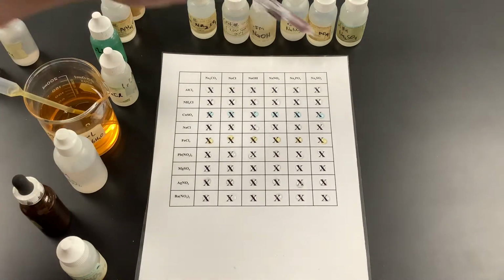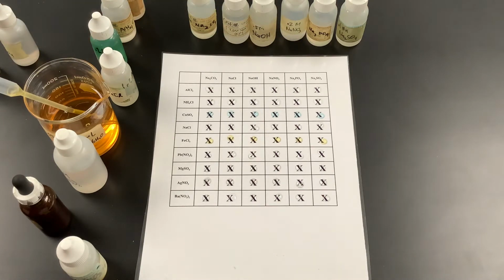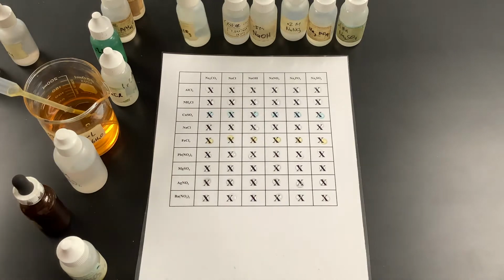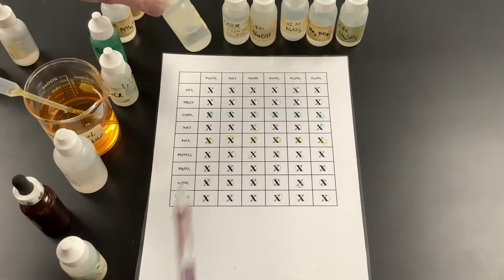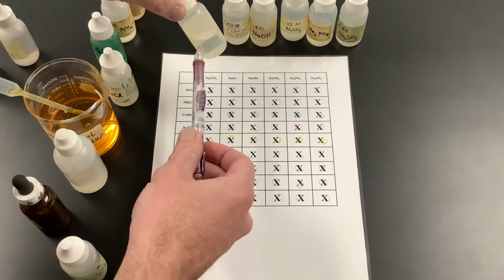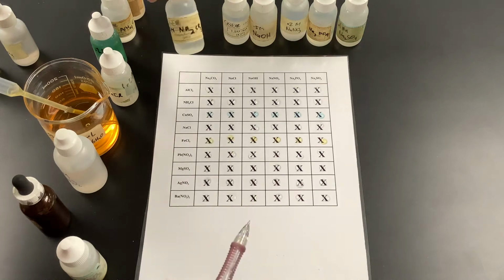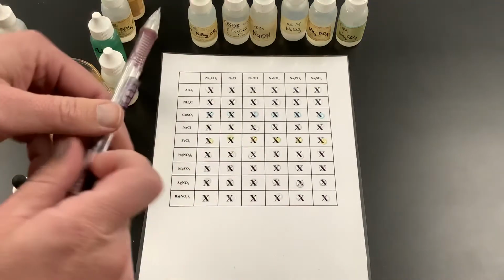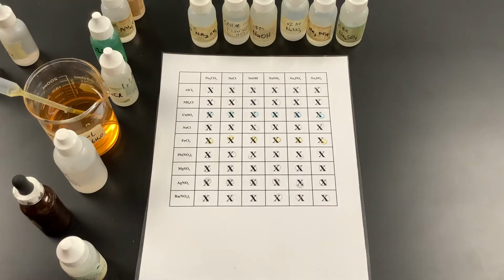The chemicals across the top are all going to be aqueous. They are all chemicals that dissolve really well. For example, this bottle says it's got Na2CO3 in it, and in reality they are completely dissolved. You can see that it's nice and clear. That means there are some Na+ floating around and some CO3 2- floating around. We are going to be focusing on the CO3 2- for this particular chemical.